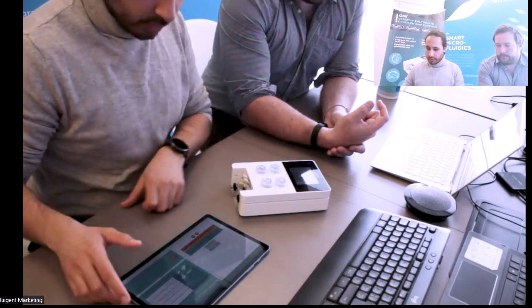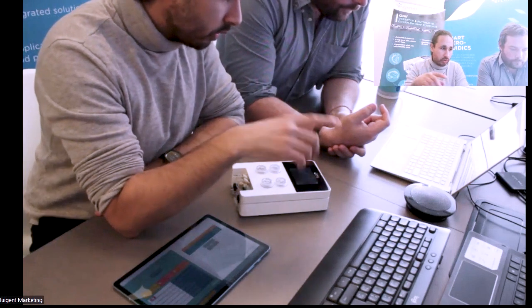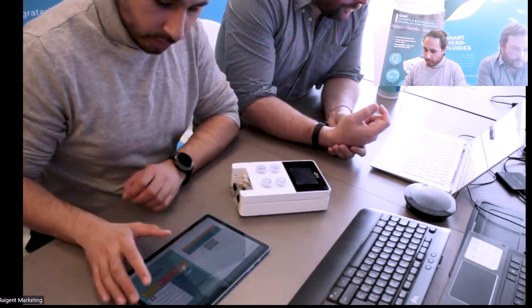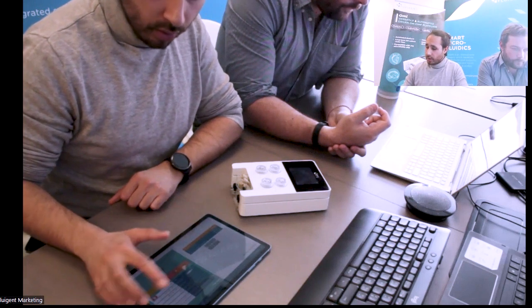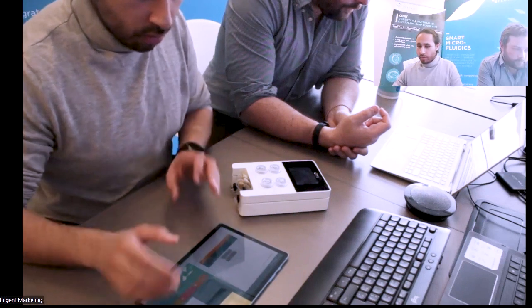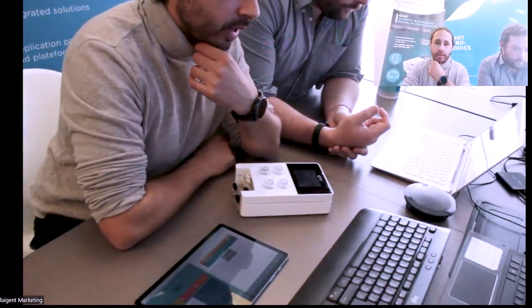When it's done, if I'm in Wi-Fi, I have all my data on my cloud, so on the OMI website. Otherwise, I have it locally in OMI, and I can just save the data in an Excel file on the tablet, and then I can make, let's say, my analysis of all the data that I have.